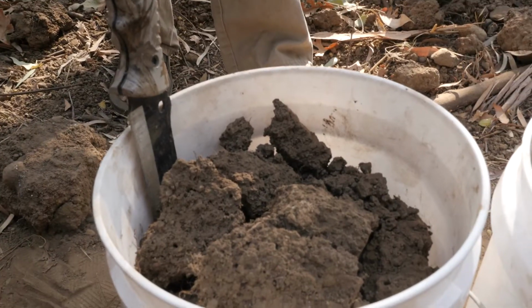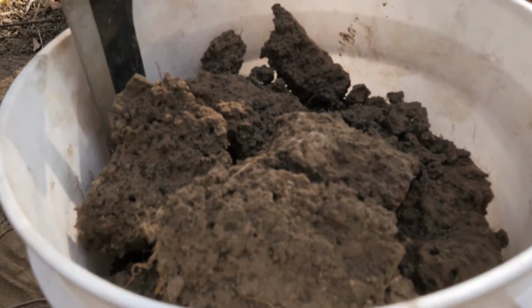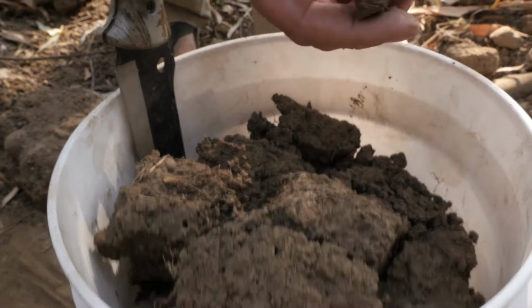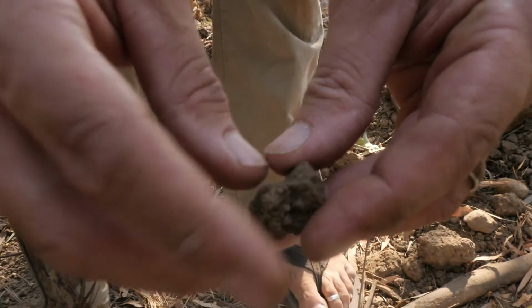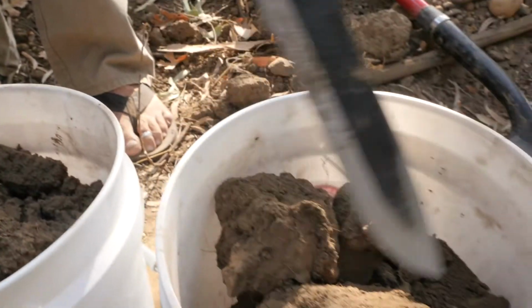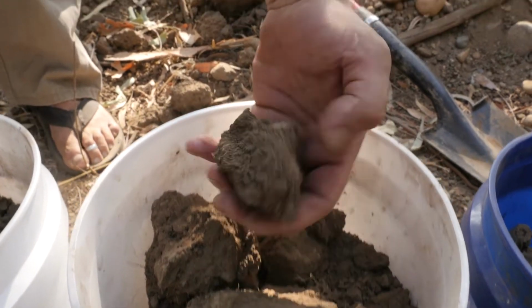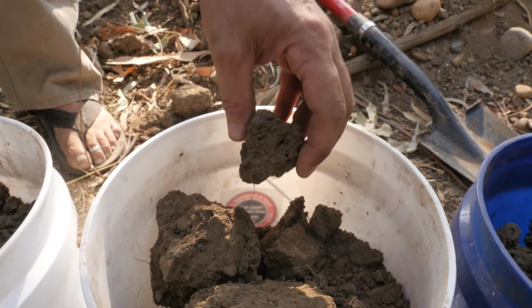Here we have the profile sampled from the surface soil, the upper A horizon here with the knife for scale. You can see these beautiful aggregates that came out and their sub-aggregates, granular structure. Even right there, you can see those little bubbles. Those are probably like a krotovina or a filling of a channel. Then we're going to move down to this second surface horizon. Same deal, you're starting to see a little bit more consistence, but still that beautiful dark color. If we wetted this up, it would really pop out.